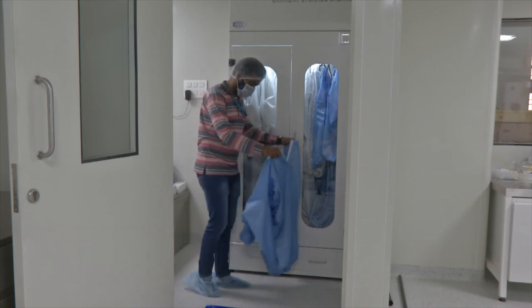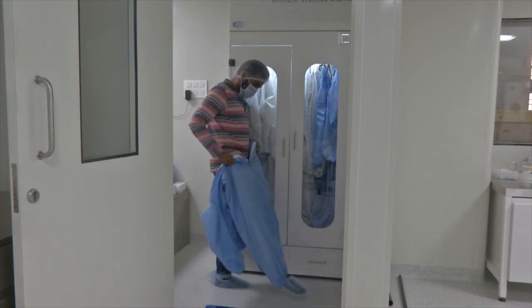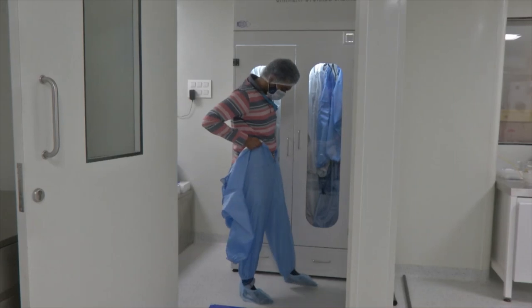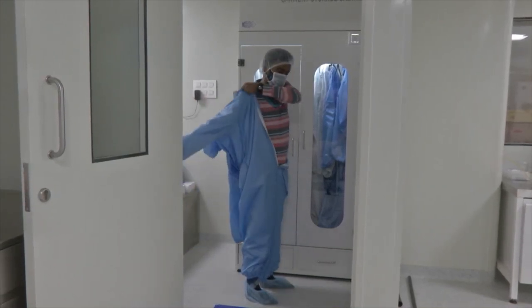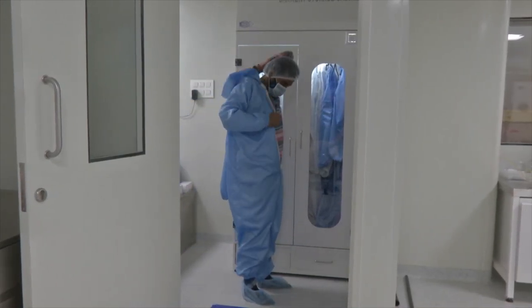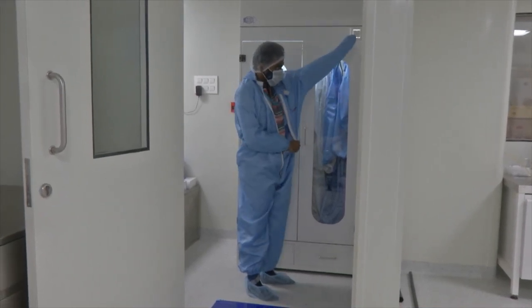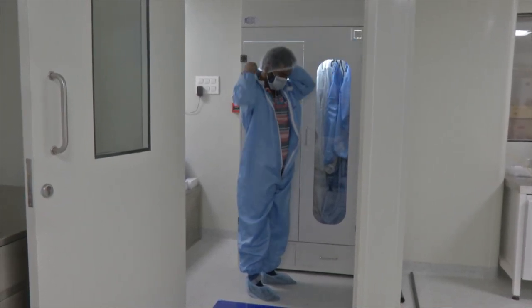My colleague is now demonstrating the process of wearing a clean room gown. The clean room gown is the second last step, after which the last step of entering the clean room is wearing gloves.